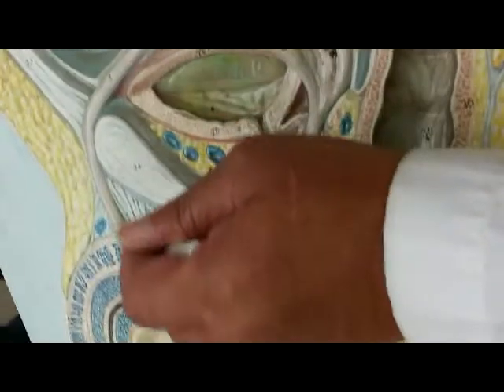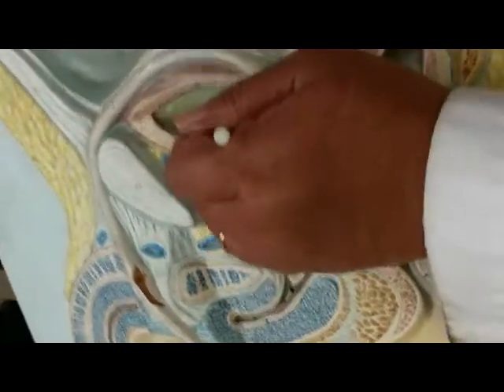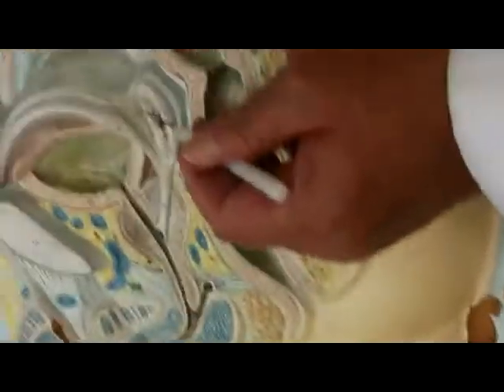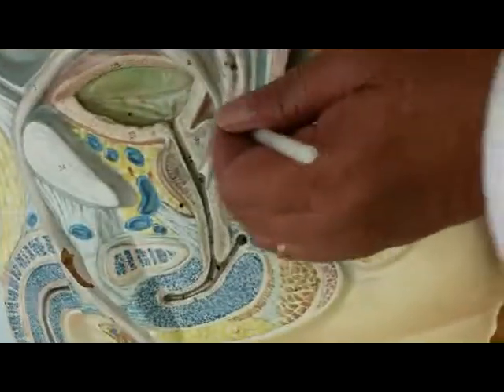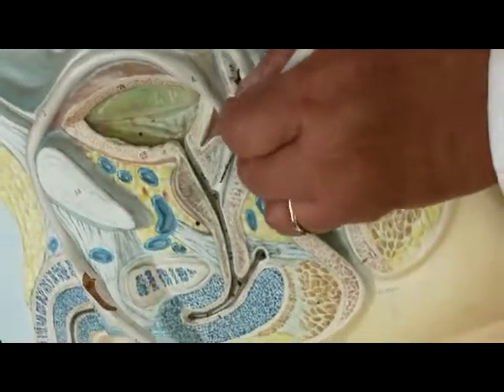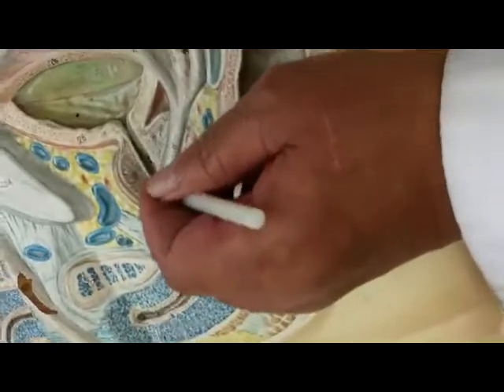And now it goes right inside of the body. It was hanging outside, and it goes around the urinary bladder. So let's follow the vas deferens, see where it's going. This is a seminal vesicle, the same one that we saw on the outside near the urinary bladder. So the seminal vesicle releases what? Semen. And so now the sperms will be floating in the semen, but this duct is called what? The ejaculatory duct. And this would be what? The prostate gland.